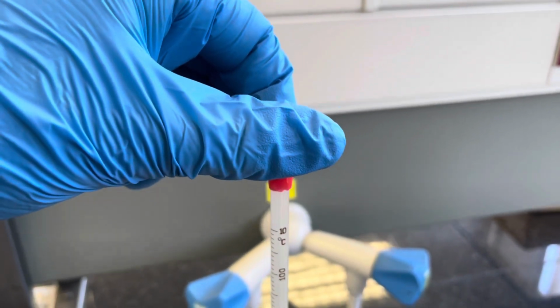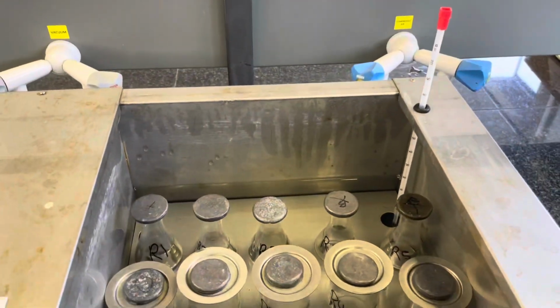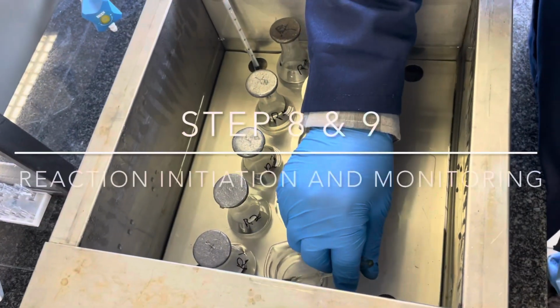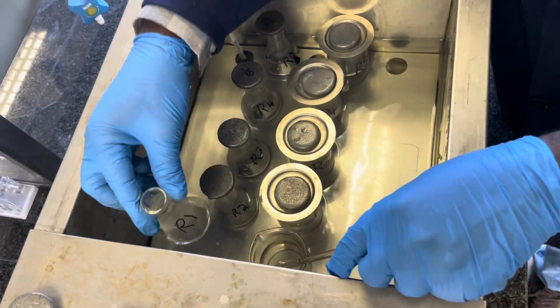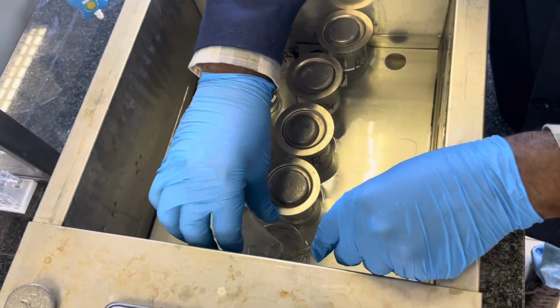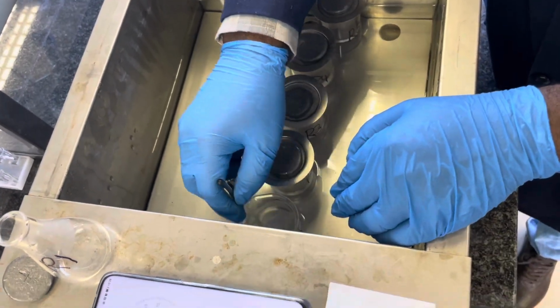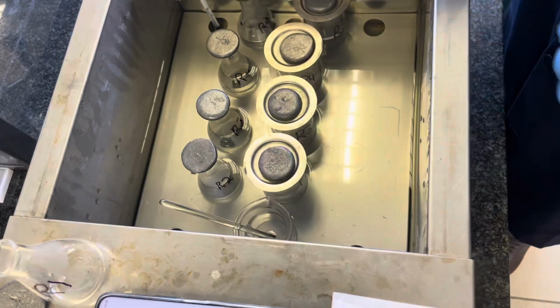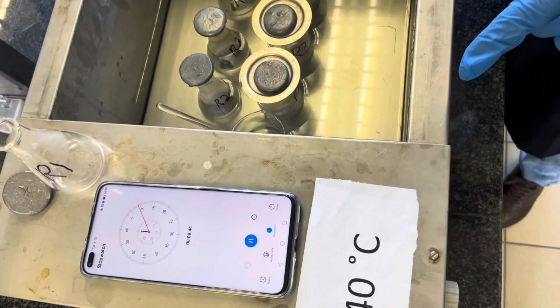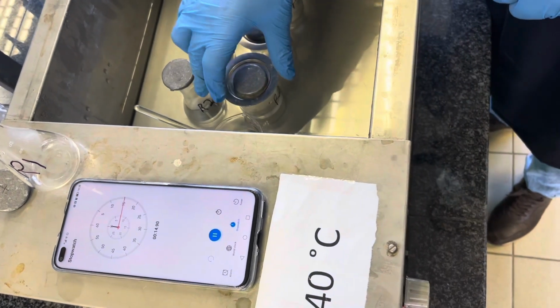Always ensure when you're touching a thermometer to hold it by the plastic handle at the top, since the heat of your hand can disrupt its equilibrium. Now we need to add our potassium persulfate to each of our reaction mixtures. You need to do this quickly, though not too quickly, since you can monitor the times quite precisely. Once you've added the first mixture, start your timer to have the initial time measurement for your first reaction mixture. Note down the time and then proceed to the next mixture. This will give you the initial starting times for each of your reaction mixtures.